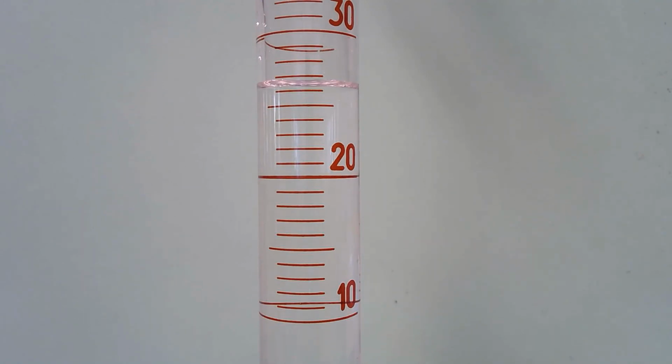Looking at part C, volume determination, I used my beaker and added about 25 milliliters of water to the 50 milliliter graduated cylinder. It doesn't have to be exact because I'll be subtracting the initial volume after I put the brass in. You can see the meniscus, and I have the graduated cylinder against a contrasting green sheet of paper. Go ahead and take that initial volume measurement of the water, and then I will add the brass cylinder to it.